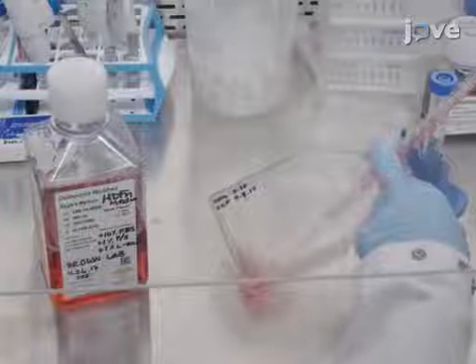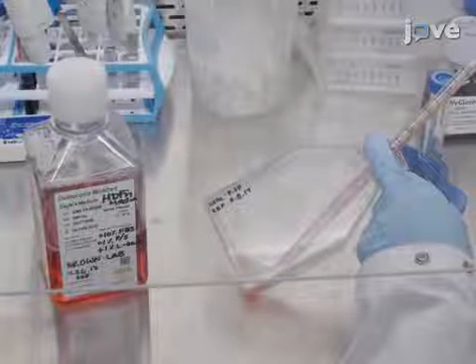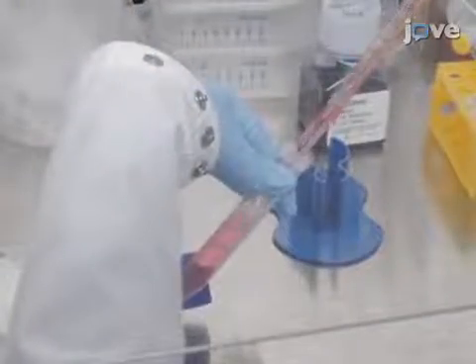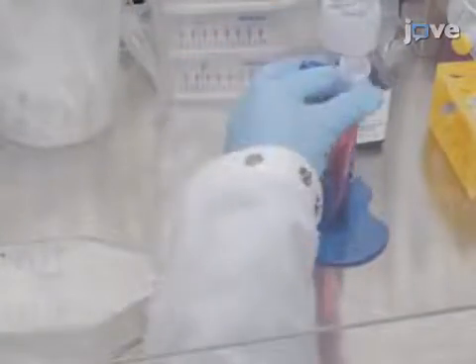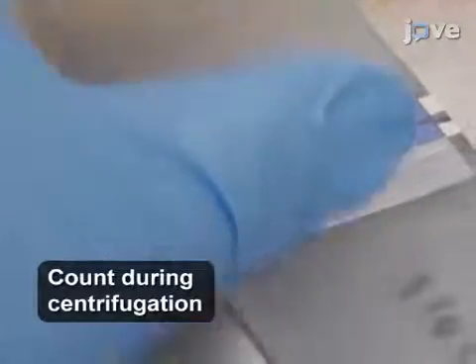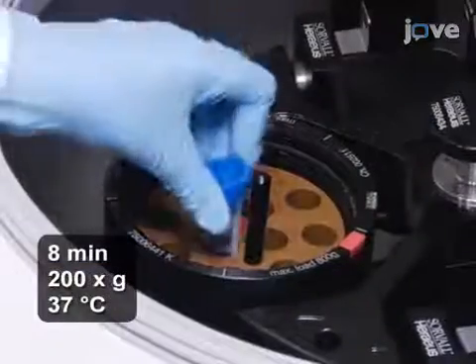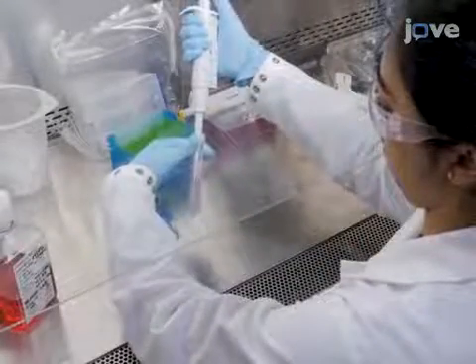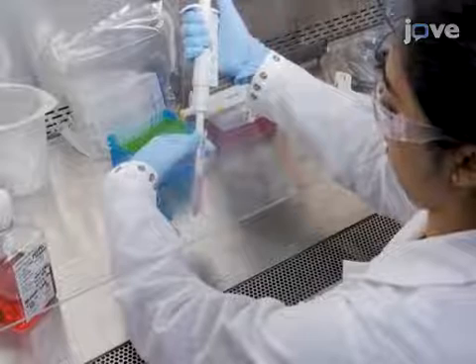After 5 minutes at 37 degrees Celsius, neutralize the trypsin with 5 milliliters of warmed medium and mix 40 microliters of cells with trypan blue at a 1:1 ratio. Reserve a 10 microliter aliquot of cells for counting. Collect the cells by centrifugation and resuspend the pellet at a 1.25 × 10⁵ cells per milliliter concentration.